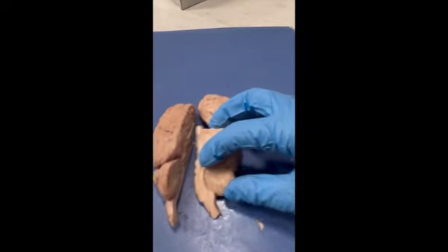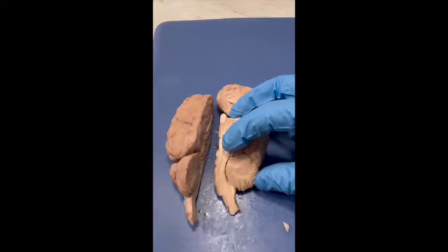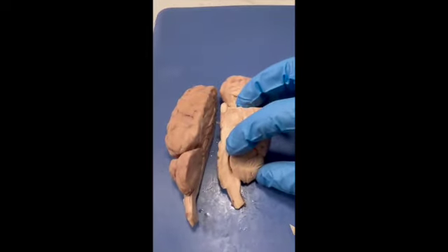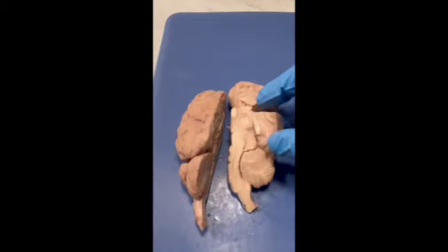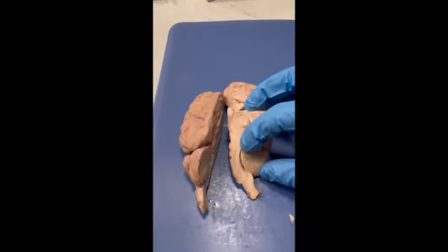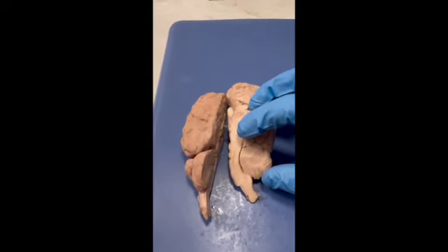And then what I thought was probably my favorite part of this, because I was kind of not looking forward to this, to be totally honest, was seeing the arbor vitae in real life, because the pictures don't do it justice, and it kind of reminds me of the bronchioles in the lungs, and it's cool to me that there's a similar structure in the brain that has a completely different function.